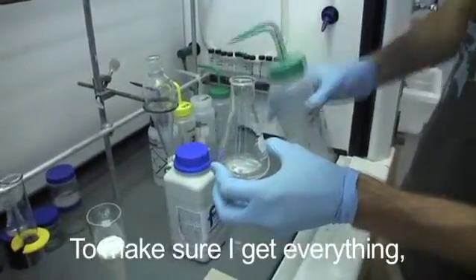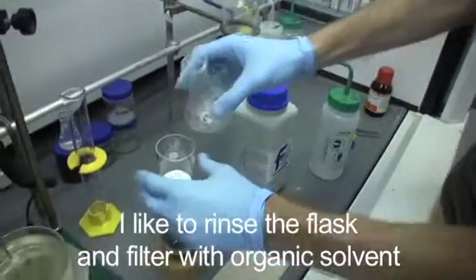To make sure I get everything, I like to rinse the flask and filter with organic solvent.